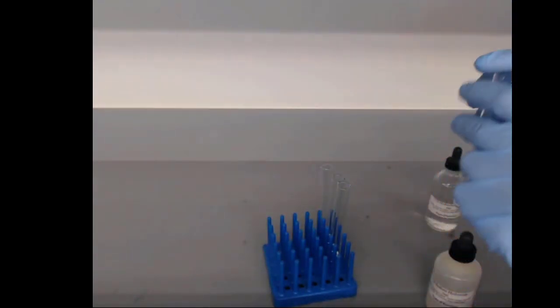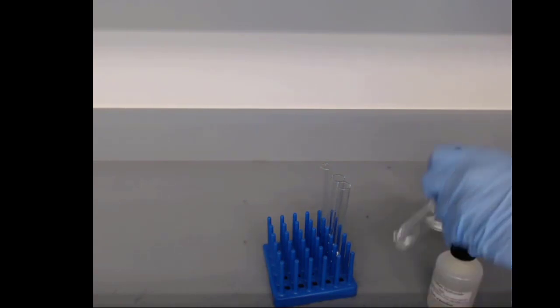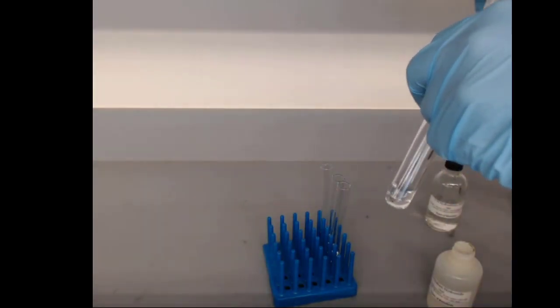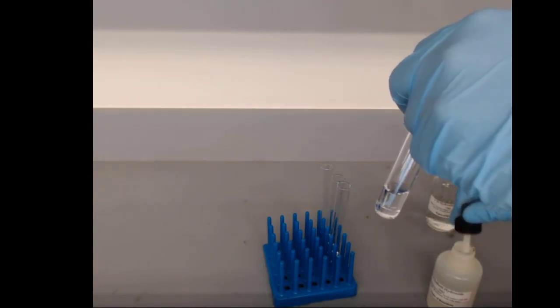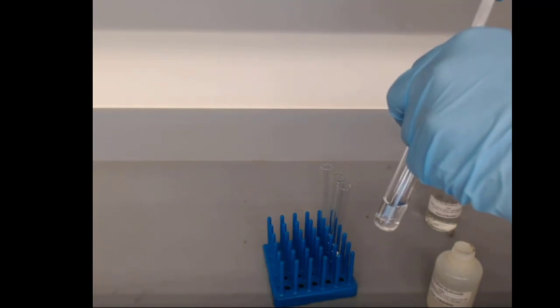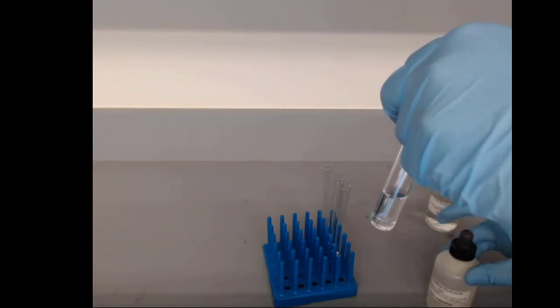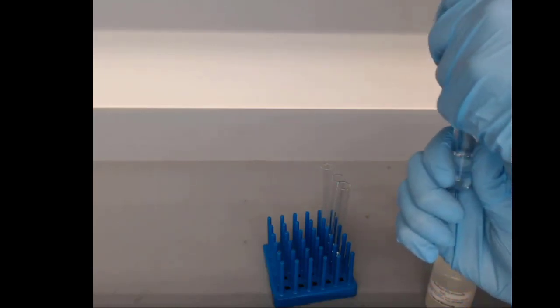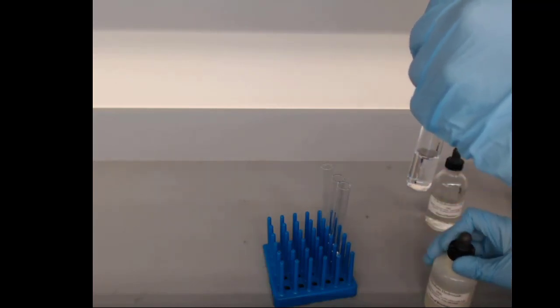Now, we know a chemical reaction is going to happen, but unfortunately, these acid-base reactions are a little bit boring, right? You're going from two clear solutions to a clear solution. It does warm up a bit. Actually, it warms up quite a bit because the reaction is releasing heat and energy.